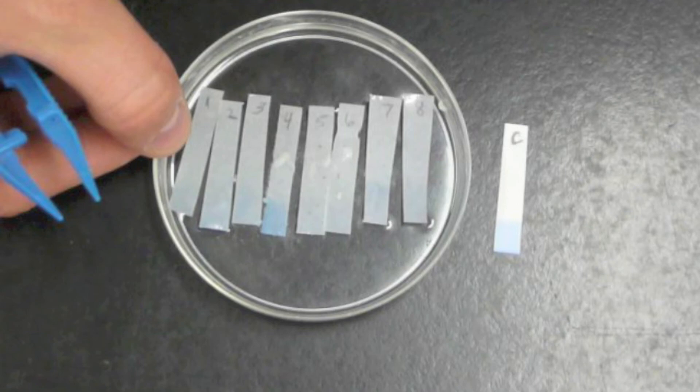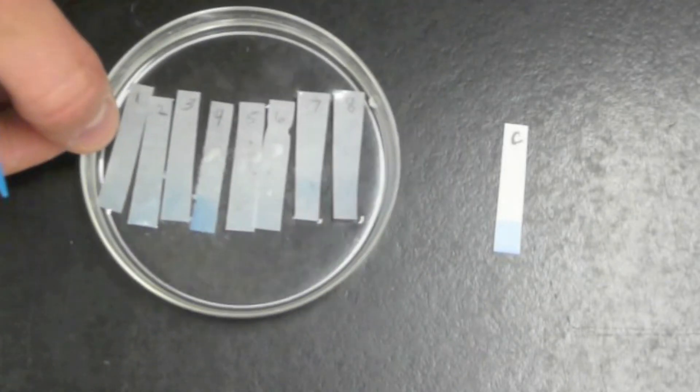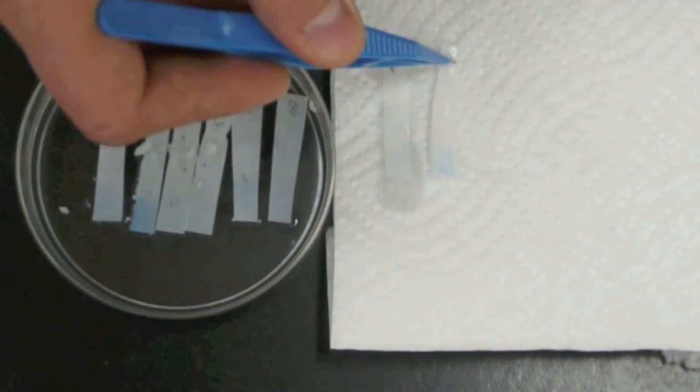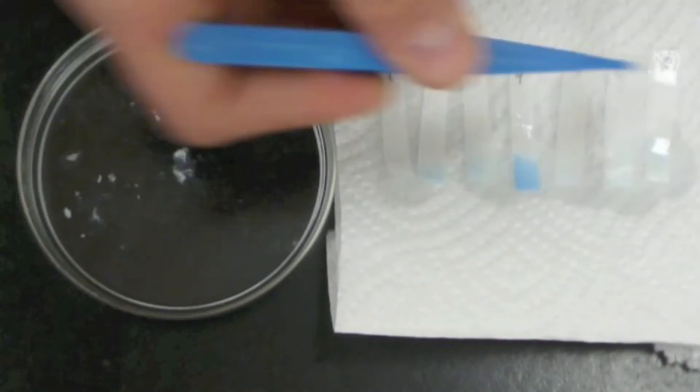Now let's check our results and see what we have. Pause the video, make your observations, write your test results, and do your post lab questions. Thank you.